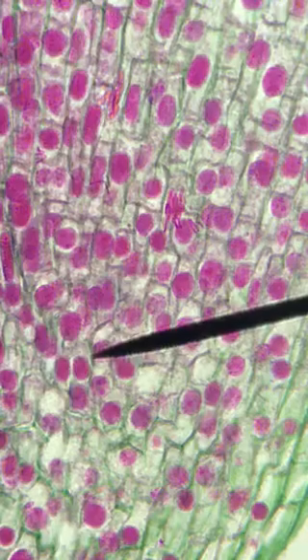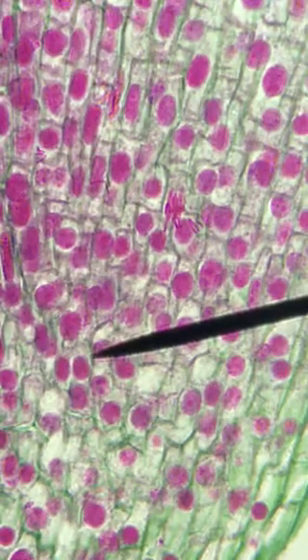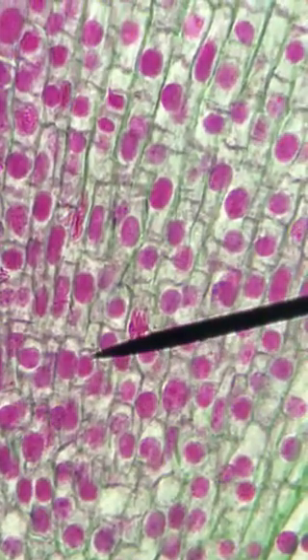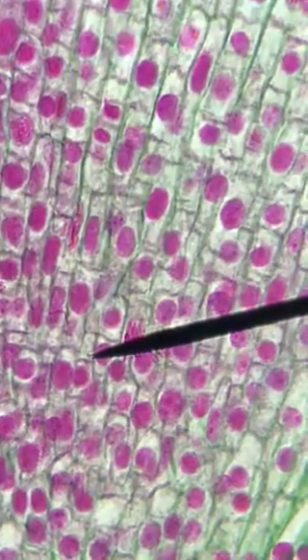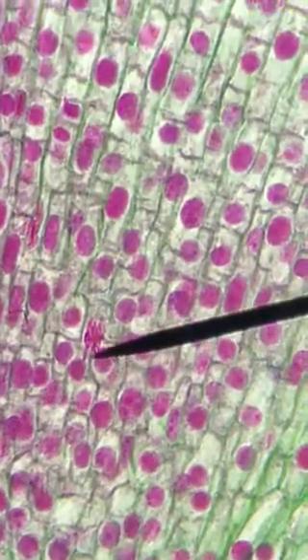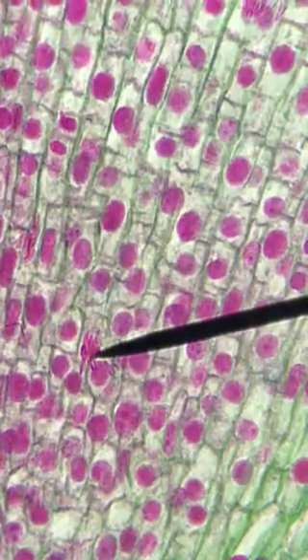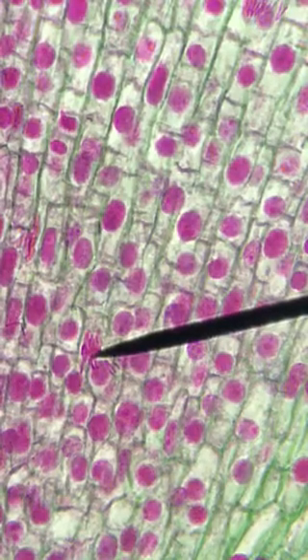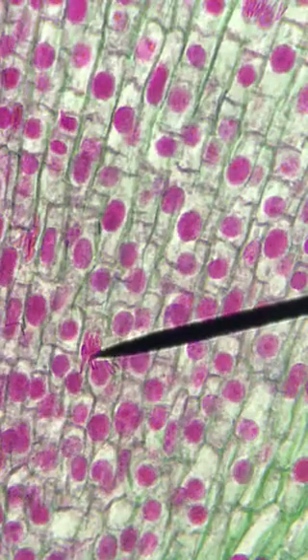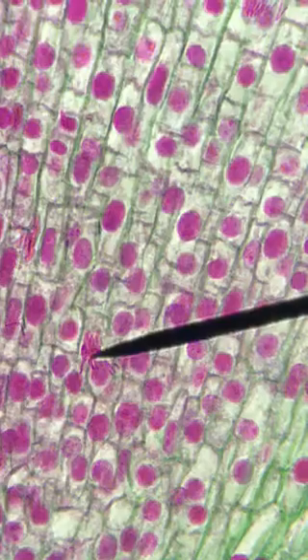Now I'm going to show you what I think is the most difficult way, but I want you to be able to see the pattern. As we go through, we're going to start moving this vertically, and I'm going to move over just a little bit because there's a cell here I'd like you to see. This would be an example of probably metaphase. When I look at this, I see the chromosomes are not inside the nuclear envelope, so they've already come outside the nuclear envelope.